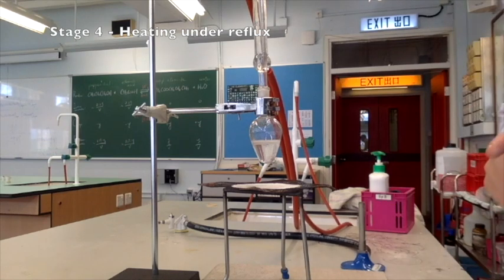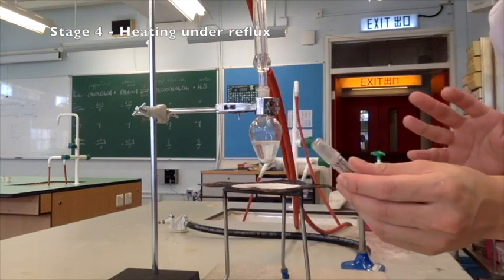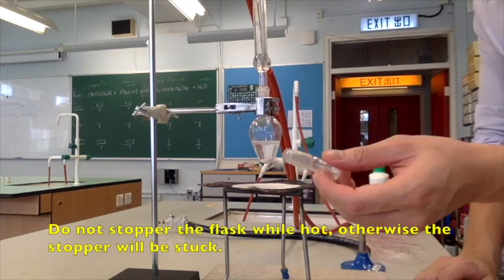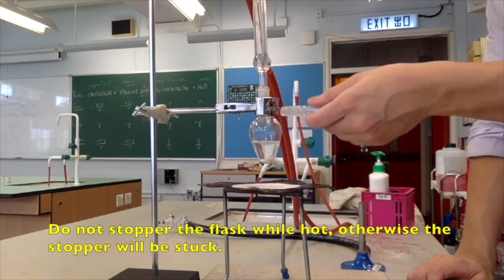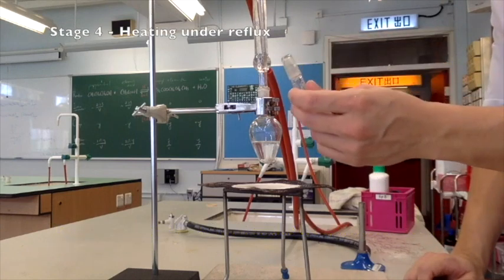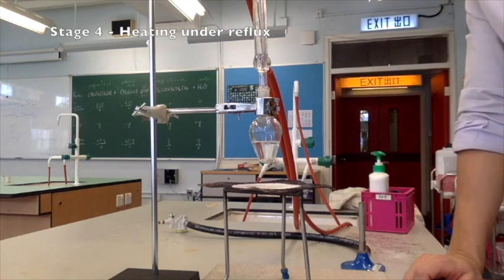Now pay attention, some of you may try to remove the condenser and then put back the stopper. This is not a good idea because you will not be able to remove the stopper later because of the thermal contraction as the pear-shaped flask contracts as it cools down. So do not put this one back. Just let it stand here for a couple of minutes and then we will cool it off using an ice bath.